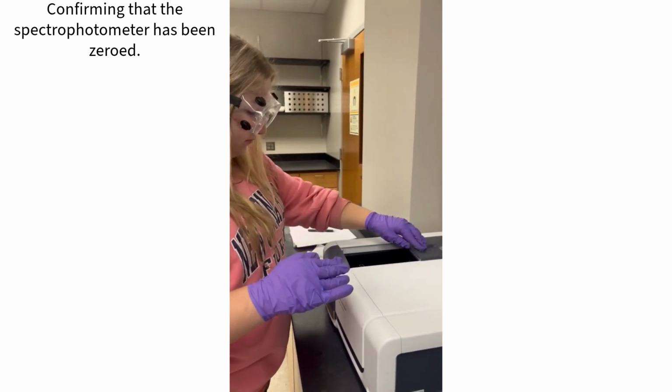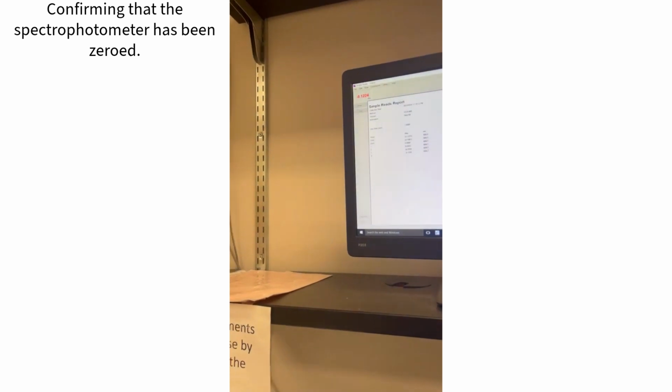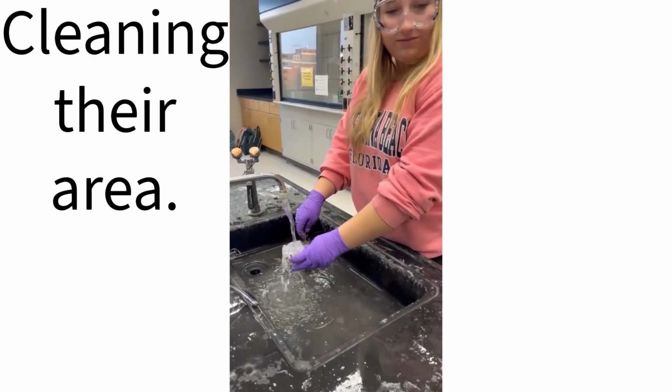I just think you want to look at this thing first. You said it? I think as long as it's zero. Don't rush these things.